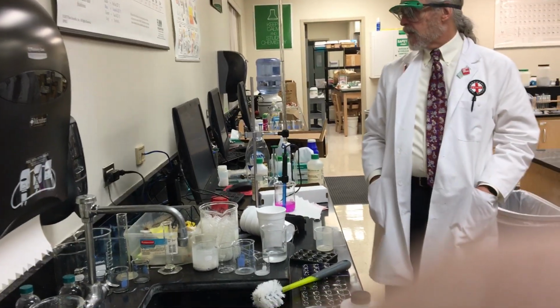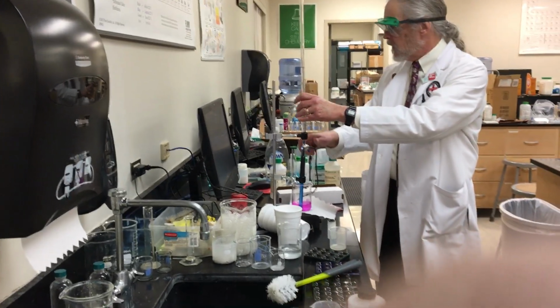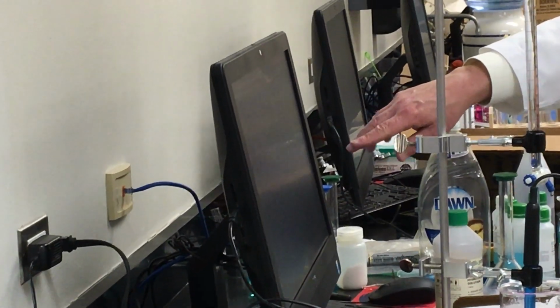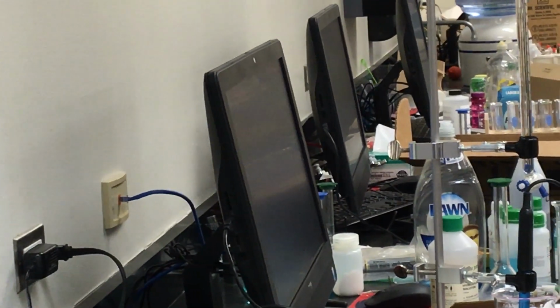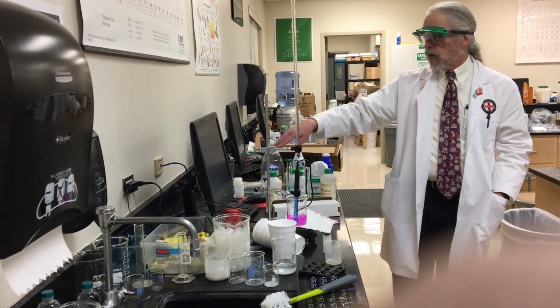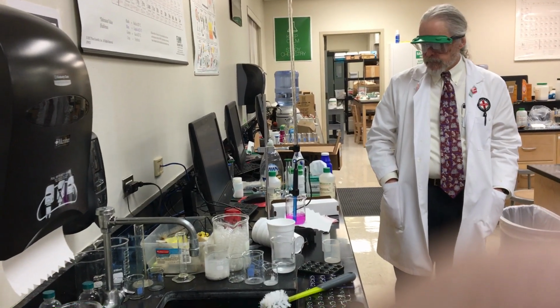Normally, students get kind of paranoid about that. They don't want to have to start over. Letting this thing go, what do you see it doing, basically? It keeps climbing, but it's going to start to level off right here because I've used up all my acid. Now I'm just adding more base, and the concentration of the base is going up, and it's going to start to level off at that point.